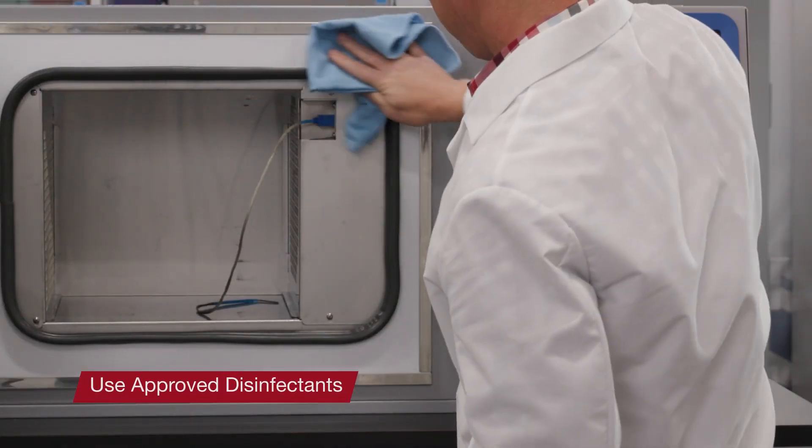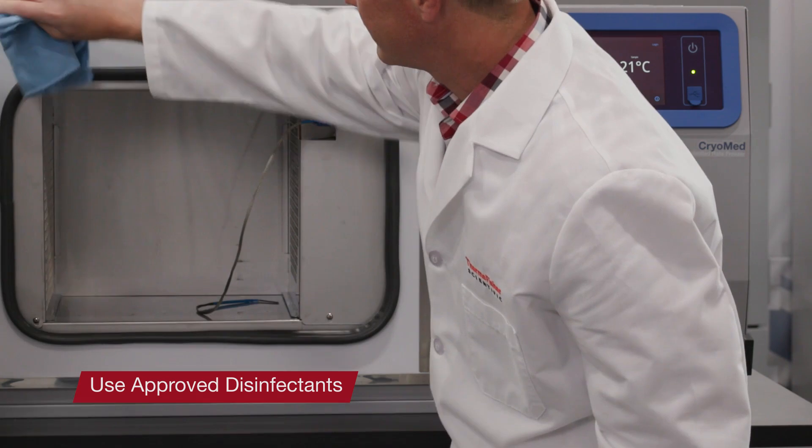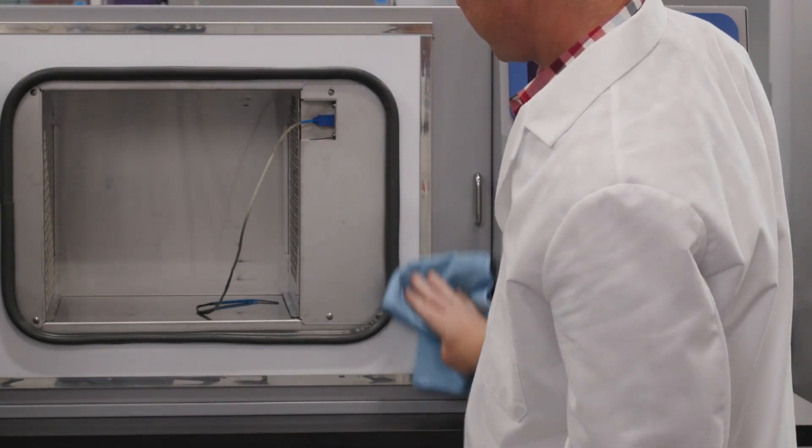Use an appropriate disinfectant. All articles and surfaces to be disinfected must be thoroughly cleaned, rinsed, and rough dried.